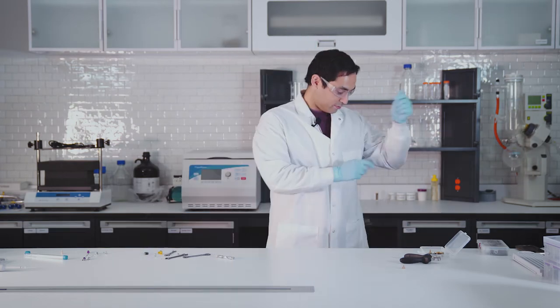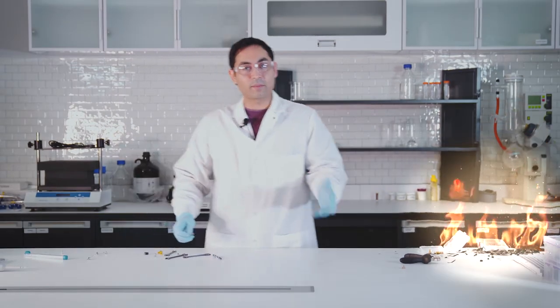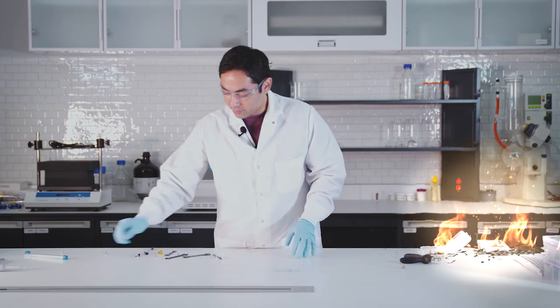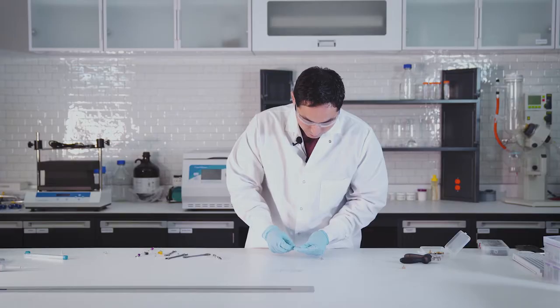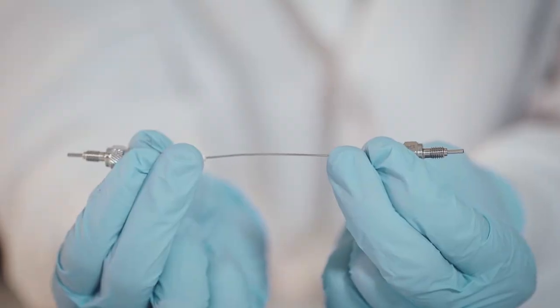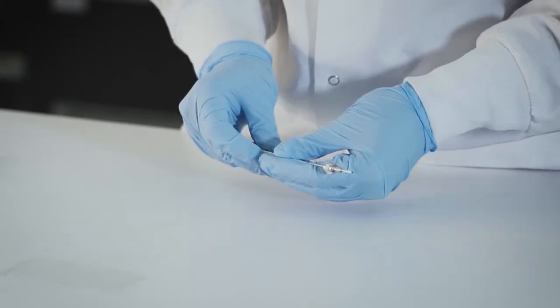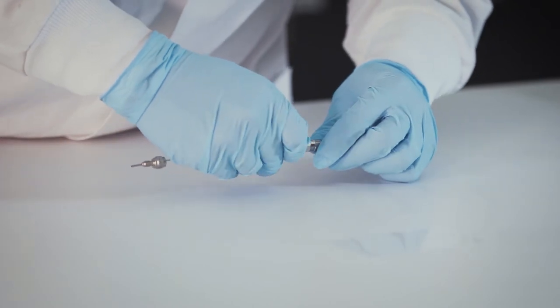I still hate this tubing. There's some tubing called flexible stainless steel which is really nice. So here's one, this one comes where the tubing and the fittings come in a set. And this is finger tight and this goes straight into the column or fitting and it's a zero dead volume.